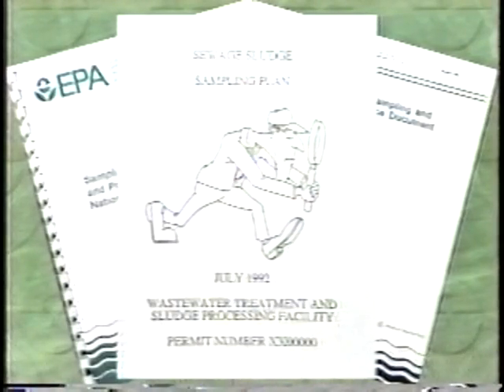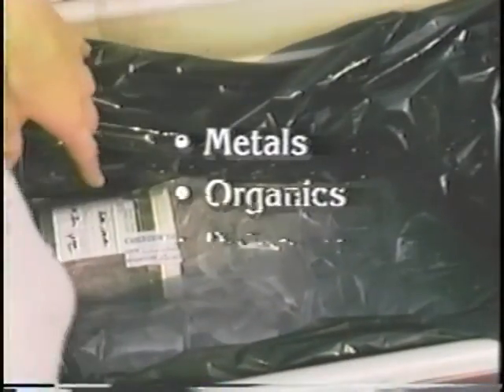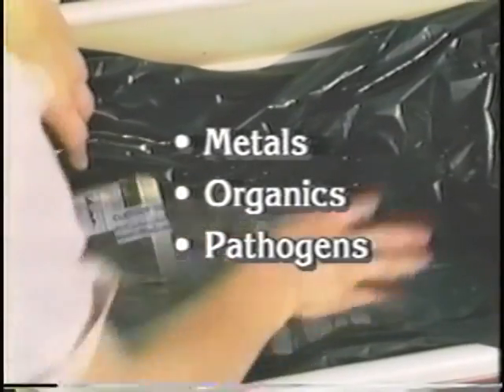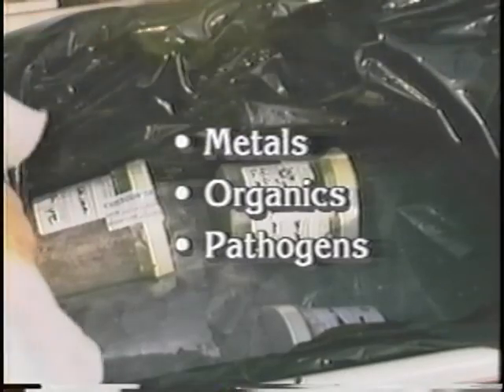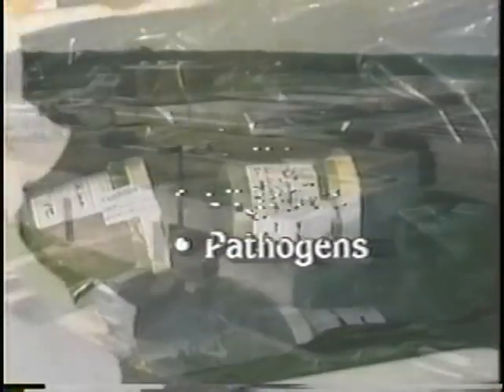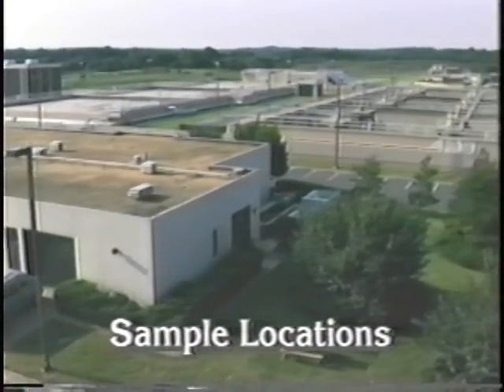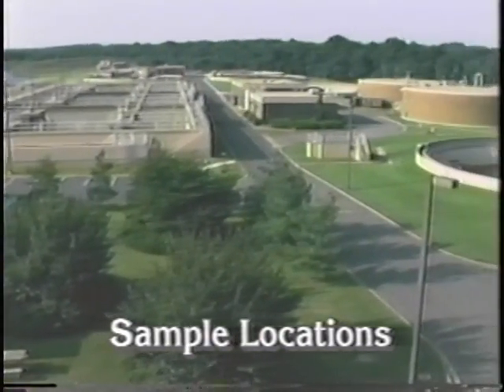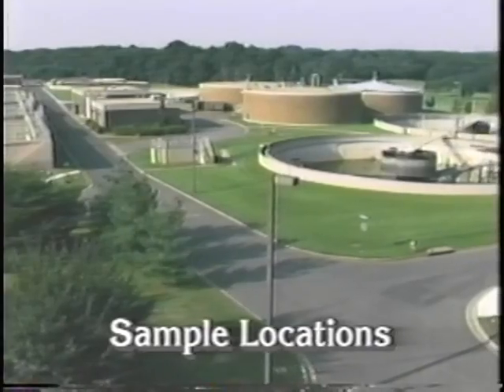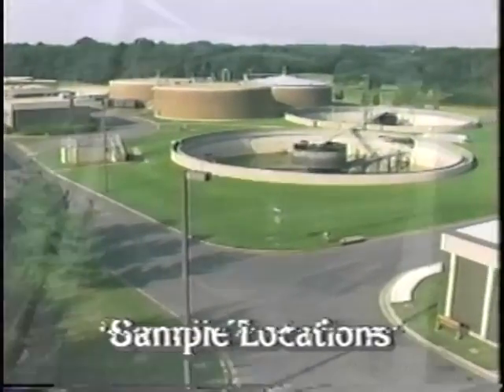One useful tool to make your sampling event most efficient is a sampling plan. Here are some key issues you need to consider before you go. Determine which parameters you are collecting samples for. At the federal level, the regulated pollutants vary depending on the final use or disposal of the sludge. Identify the types of sludge treatment units at the facility so that you have an idea of where to collect samples and the equipment you will need to collect a representative sample.